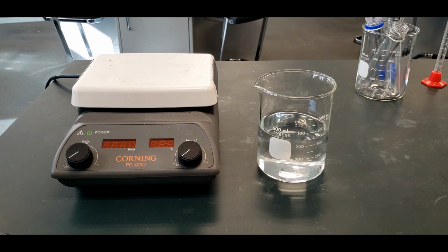All right, so this is the video for the thermodynamics of a calcium chloride solution. When we add calcium chloride to water, as it forms a solution, there is a delta H, the change in enthalpy, delta G, the change in free energy, and the delta S, the change in entropy for that process. And to find those three terms requires a lot of little experiments that we're going to do.